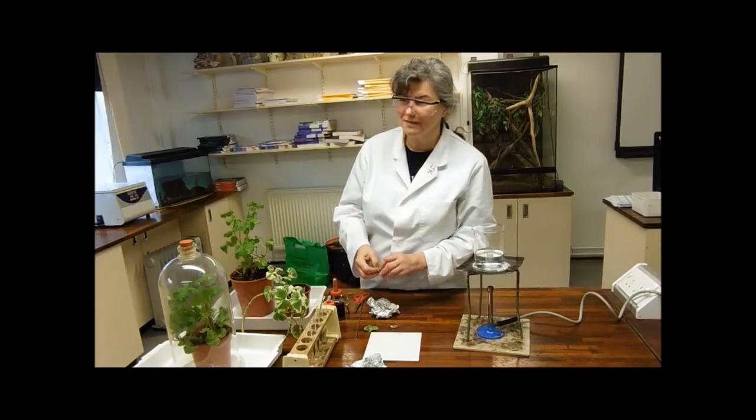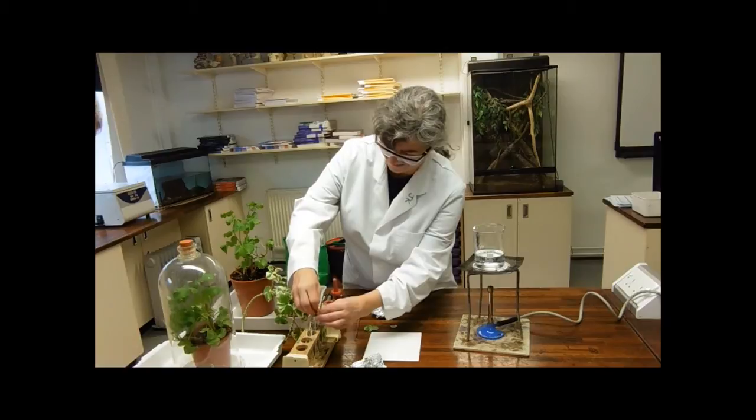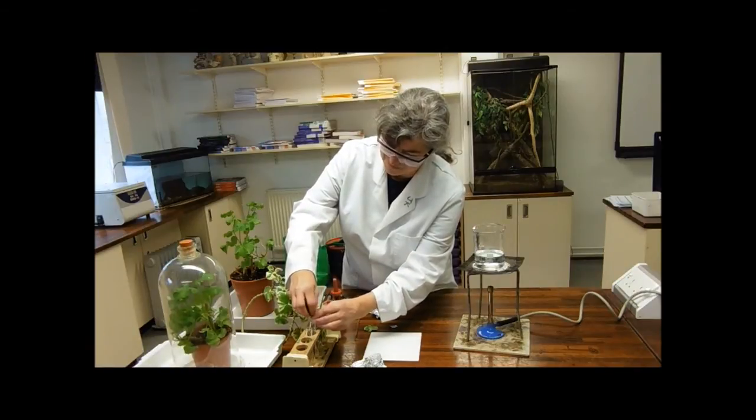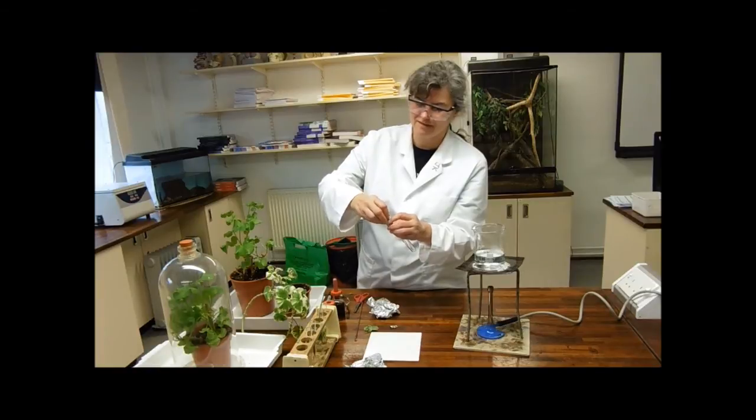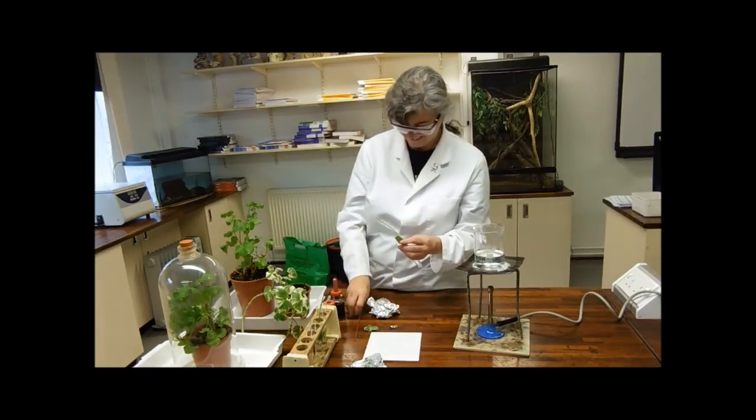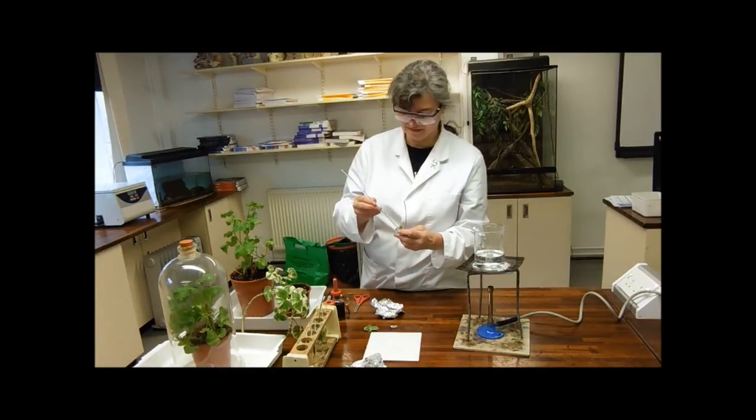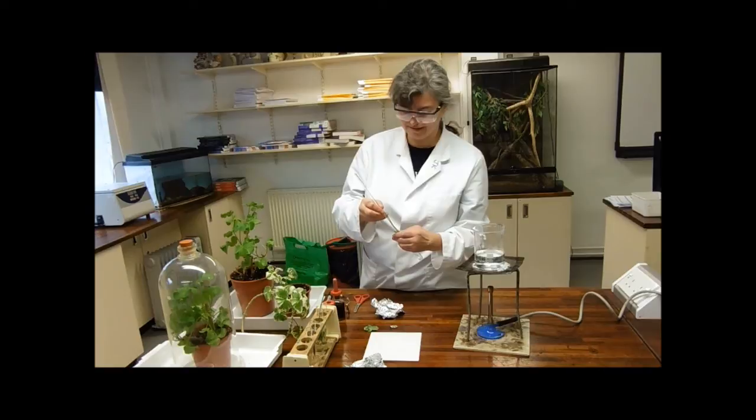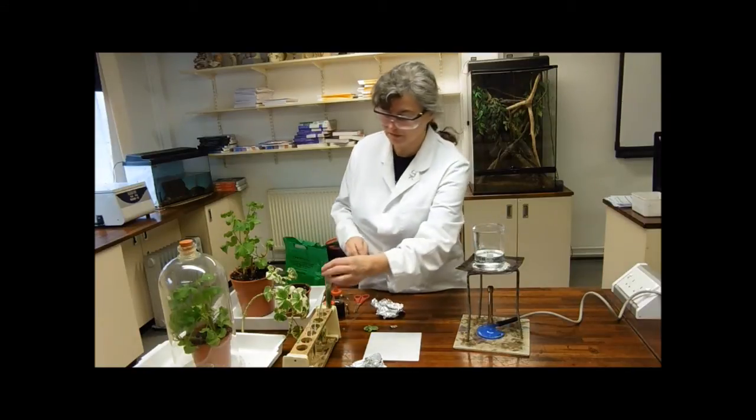Oh, an old cameraman's getting me a pair of forceps, eh? He'd make an admirable nursing assistant in an operating theatre. Oh, forgive me sakes. I thought, oh, this is nice and easy. I don't know. I should have used boiling tubes probably. When I think about it, last time I did this, I had these boiling tubes.